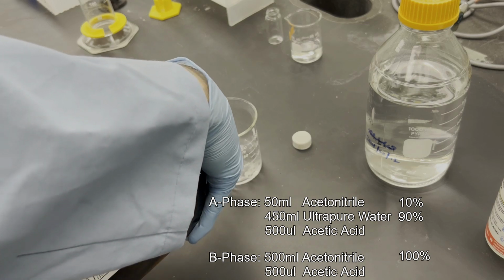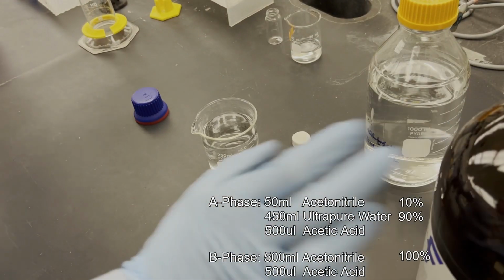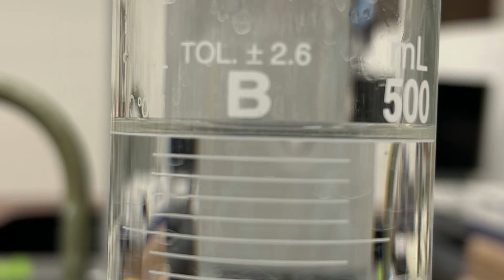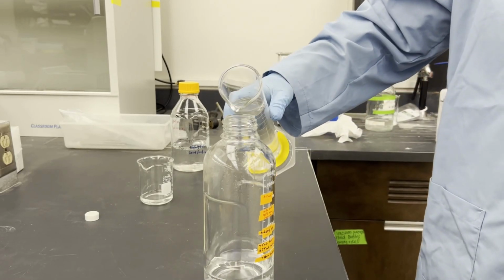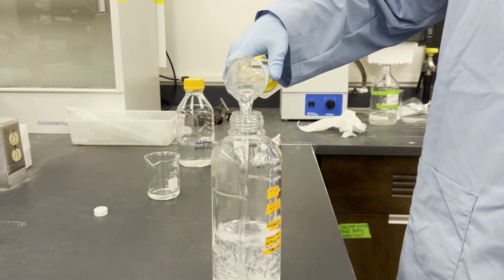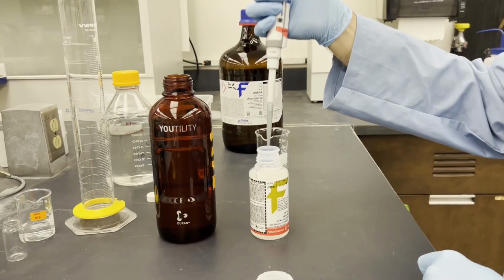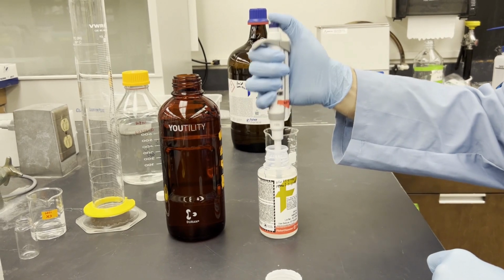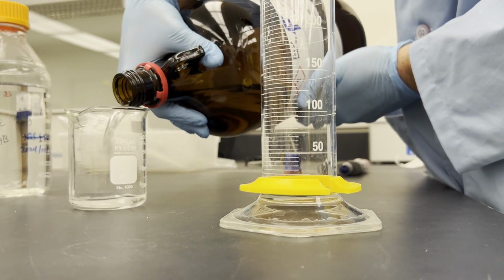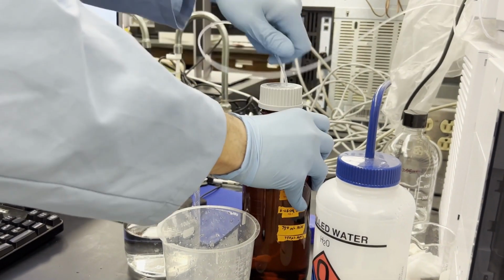The ACN bottle is rather large, so best to be safe using a transfer beaker. Add it until the meniscus reaches the measured line and pour it into the HPLC's eluent bottle slowly. We only need 500 microliters of acetic acid for both, so our Eppendorfs will be handy here. Once both are made, these bottles can be connected to the HPLC pumps.